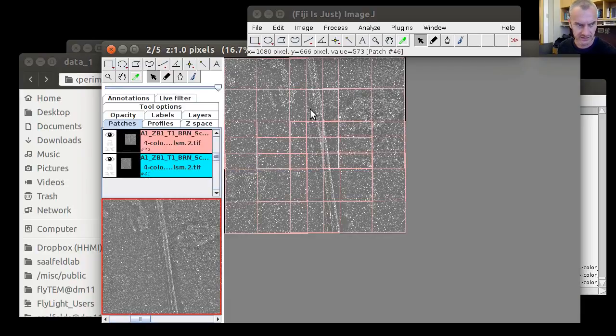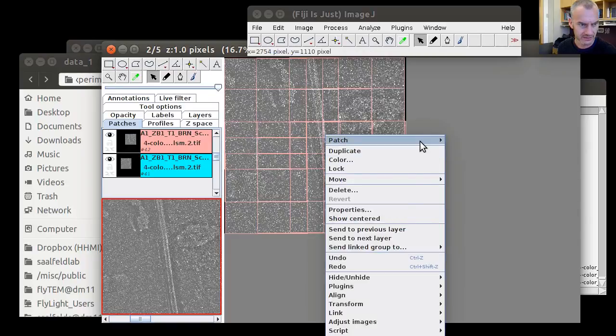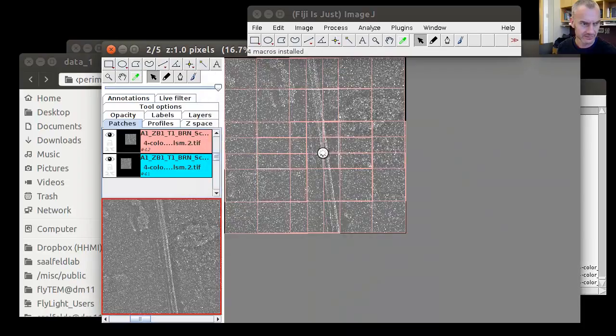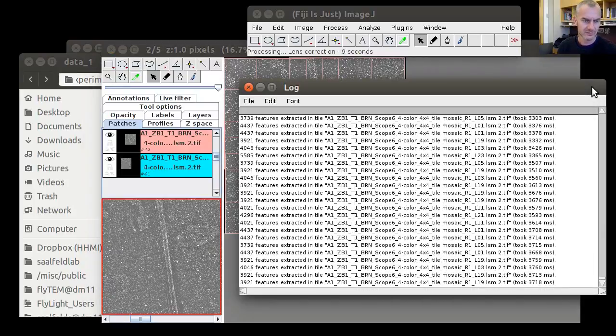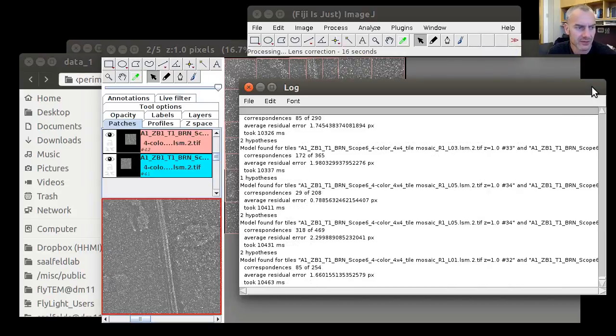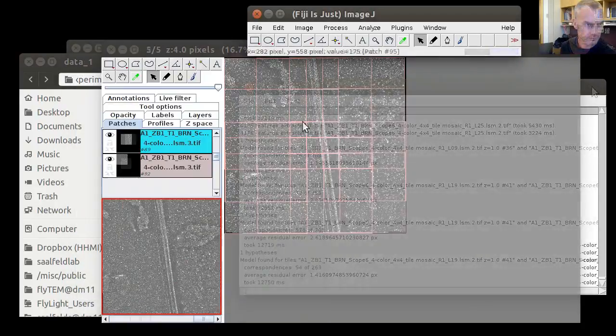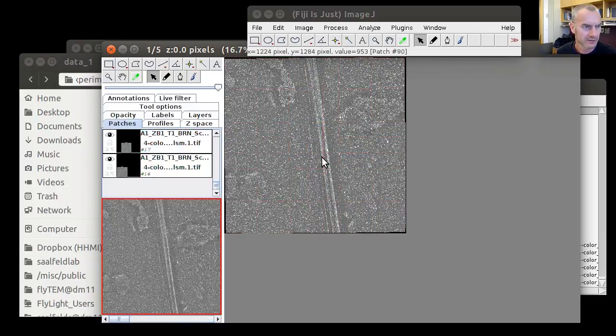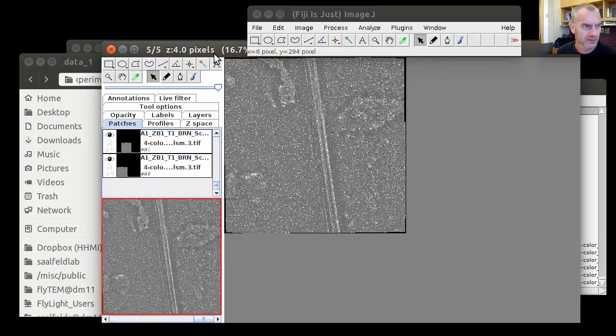Center toggle click, Ctrl A, patch lens correction. And we confirm all the dialogues as they preserve the parameter choices that we made in the first channel. We do that 5 times, for each channel independently. So now that we have a lens correction model for each of these montages, we want to visually compare them.